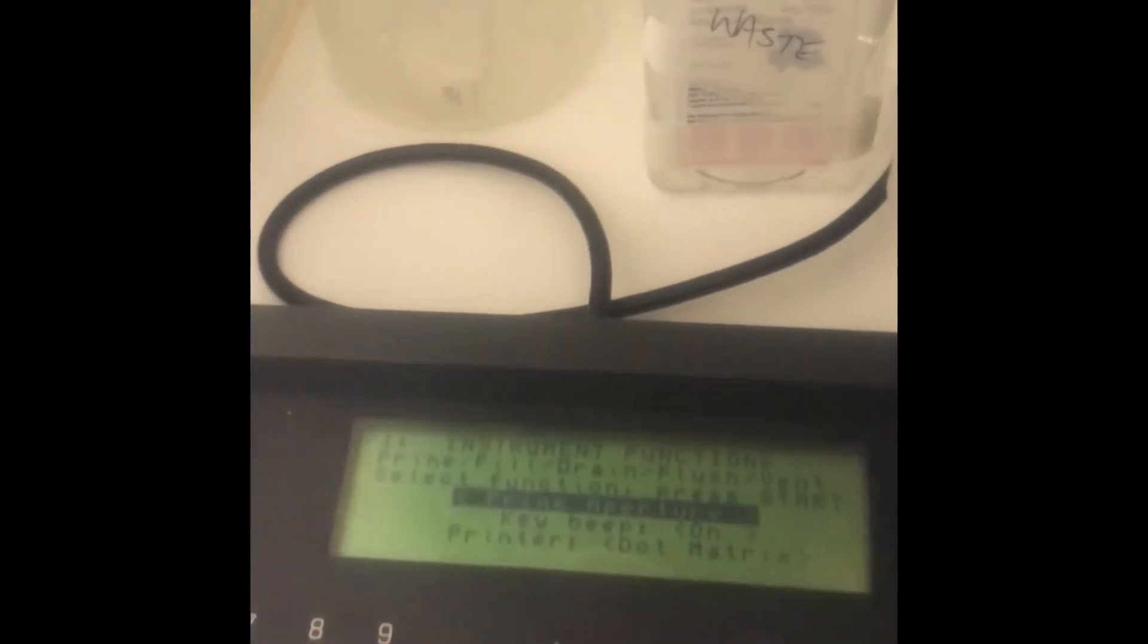After counting the cells, you need to set up to prime aperture to clean the tube of the machine so that others can use next step.